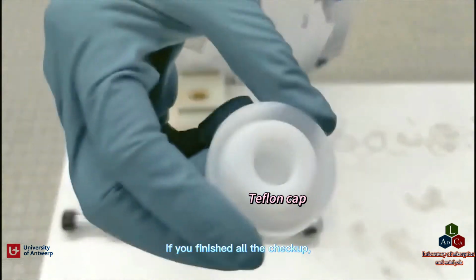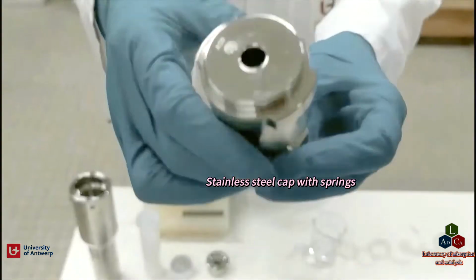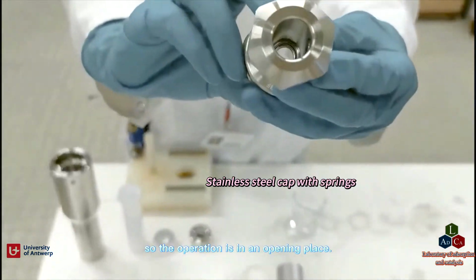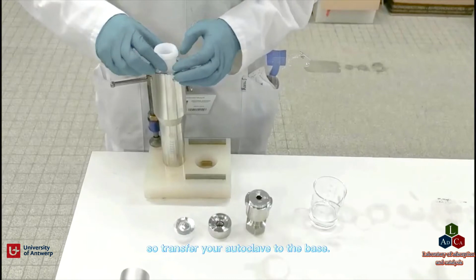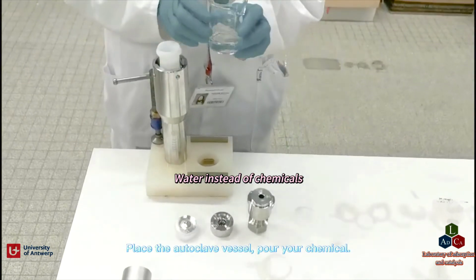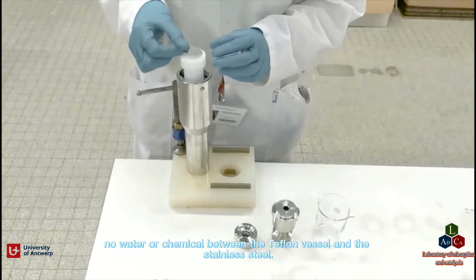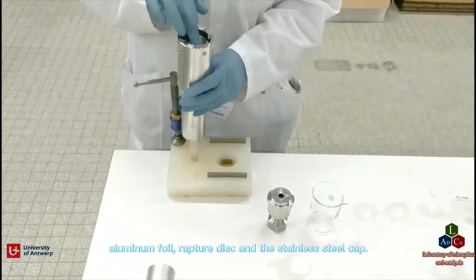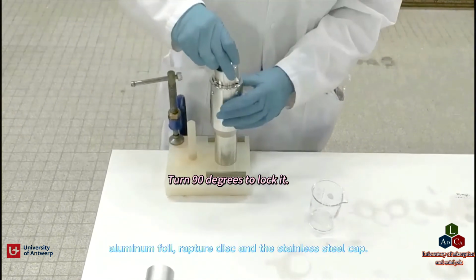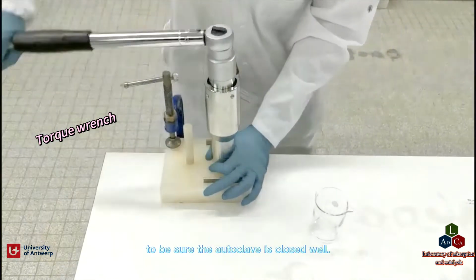If you have finished all the checks, let's start to load the autoclave, which should be done in the fume hood. I use water here, so the operation is in an open place. The bottom of the autoclave is flexible, so transfer the autoclave to the base. Place the autoclave vessel, pour in your chemical, and be sure there is no water or chemical between the Teflon vessel and the stainless steel. Cover it with the cap, aluminum foil rupture disc, and the stainless steel cap. Lock it and tighten it with the torque wrench to be sure the autoclave is closed well.